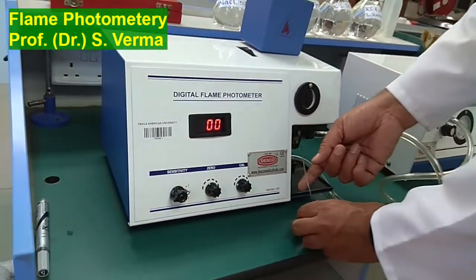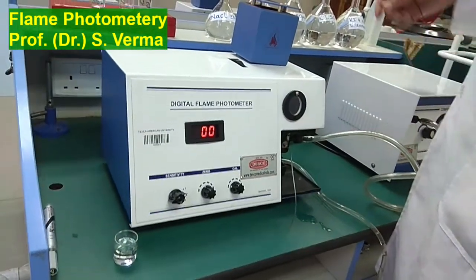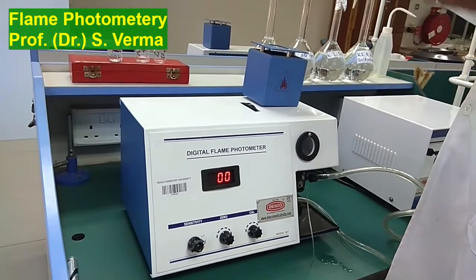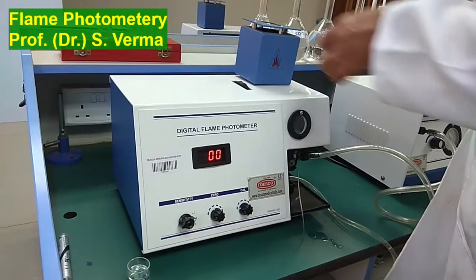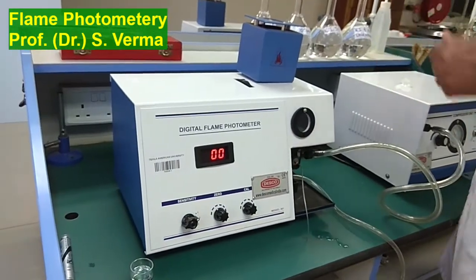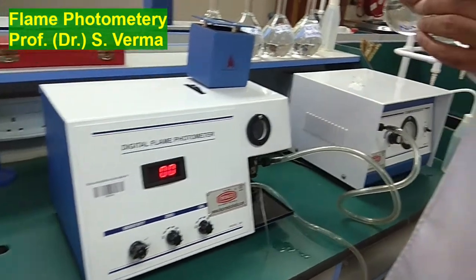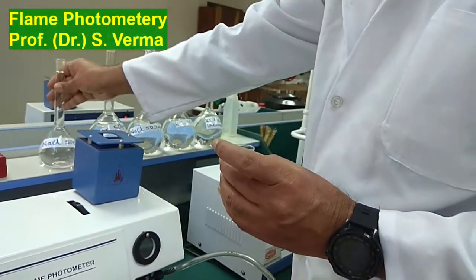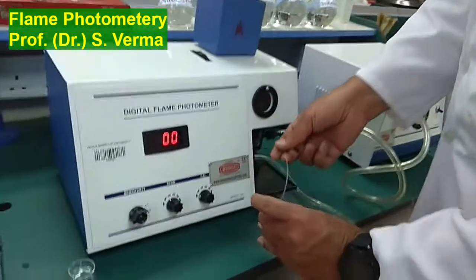Now the next task is to calibrate this instrument with a standard solution. So I'll take a sodium 50 ppm solution. This is basically made using sodium chloride, but this is a sodium ion 50 ppm solution. I'll take this solution in another container with another cell, and I know its concentration is 50 ppm, so my instrument should read 50, else I have to calibrate it.